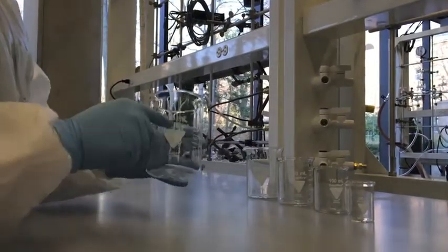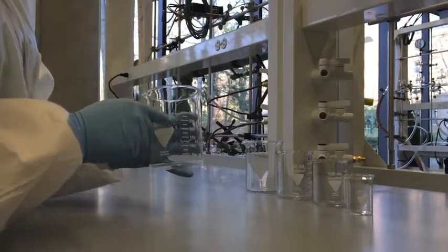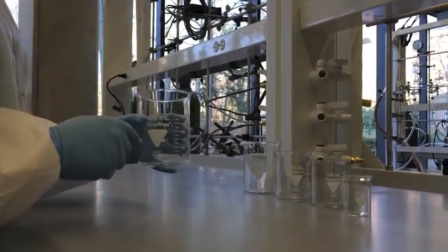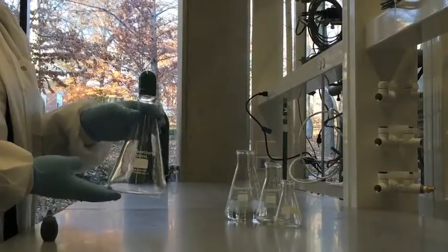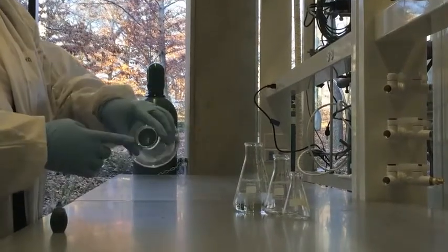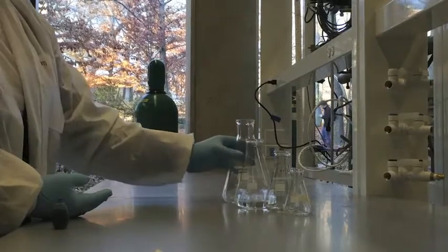Beakers are often graduated, that is, marked on the side with lines indicating the amount of volume contained. These marks are not intended for obtaining a precise measurement of volume, but rather an estimation. They are accurate to about 5%. The Erlenmeyer flask is a type of laboratory flask which features a flat bottom, a conical body, and a cylindrical neck. It differs from the beaker in its tapered body and narrow neck.